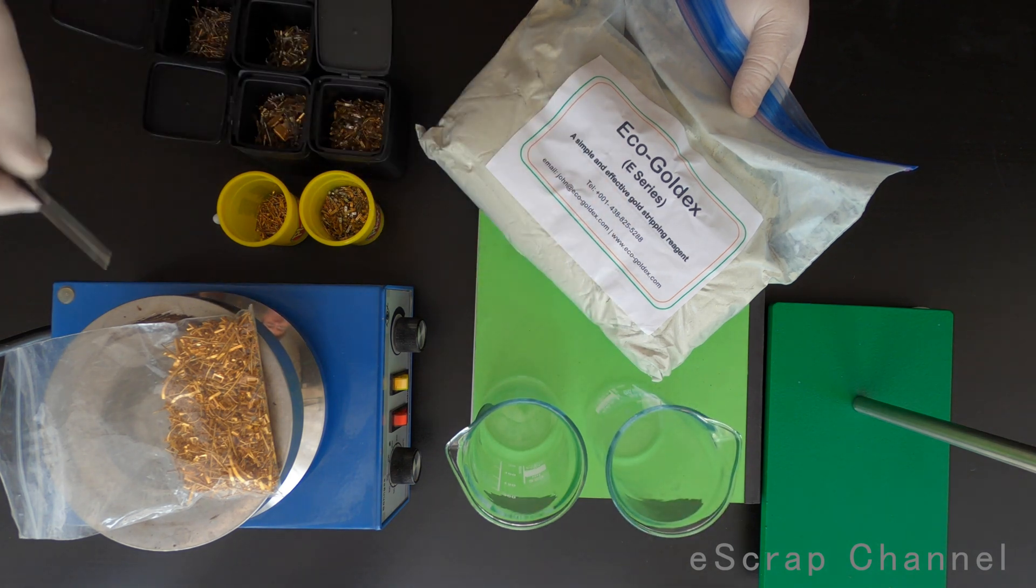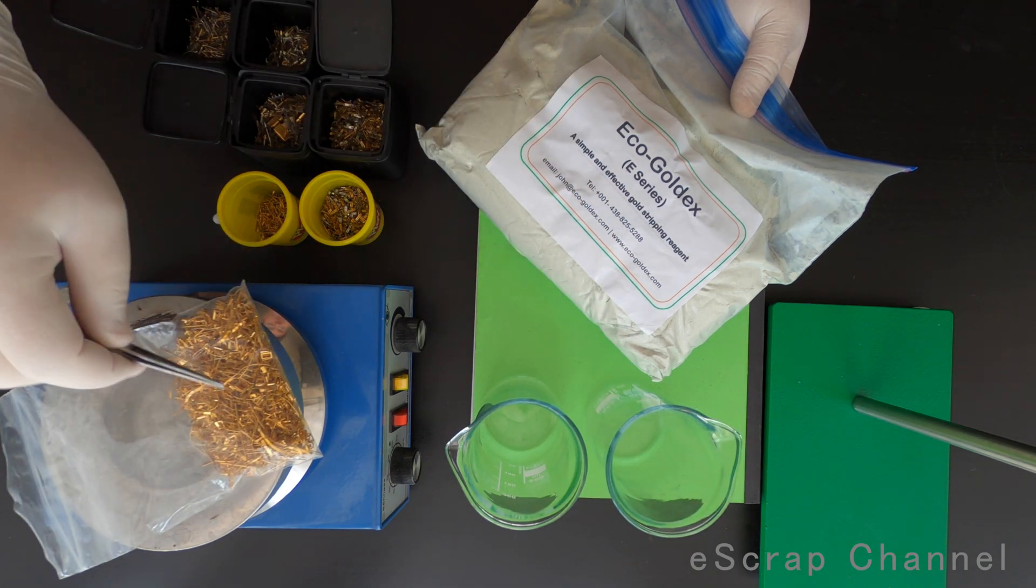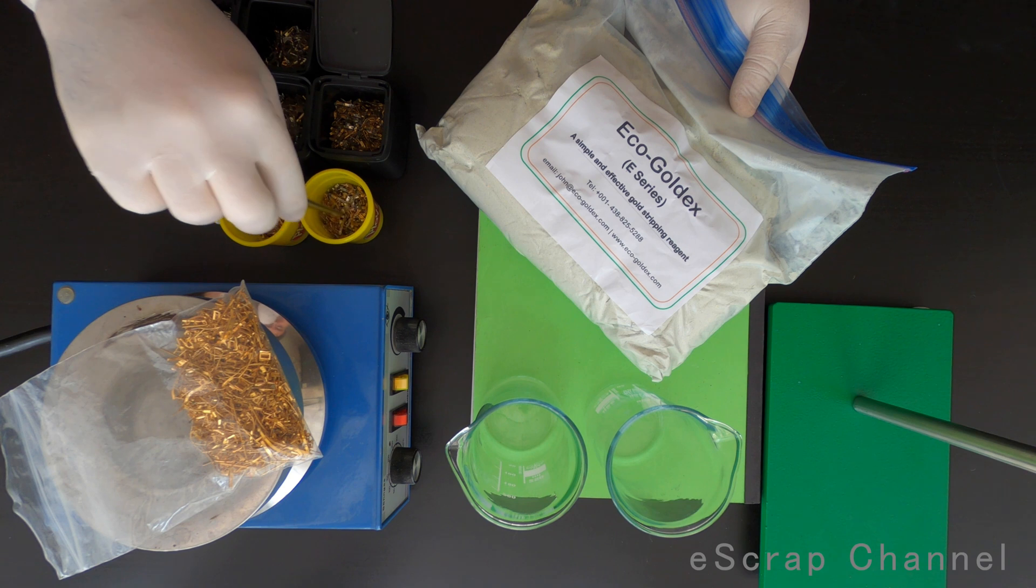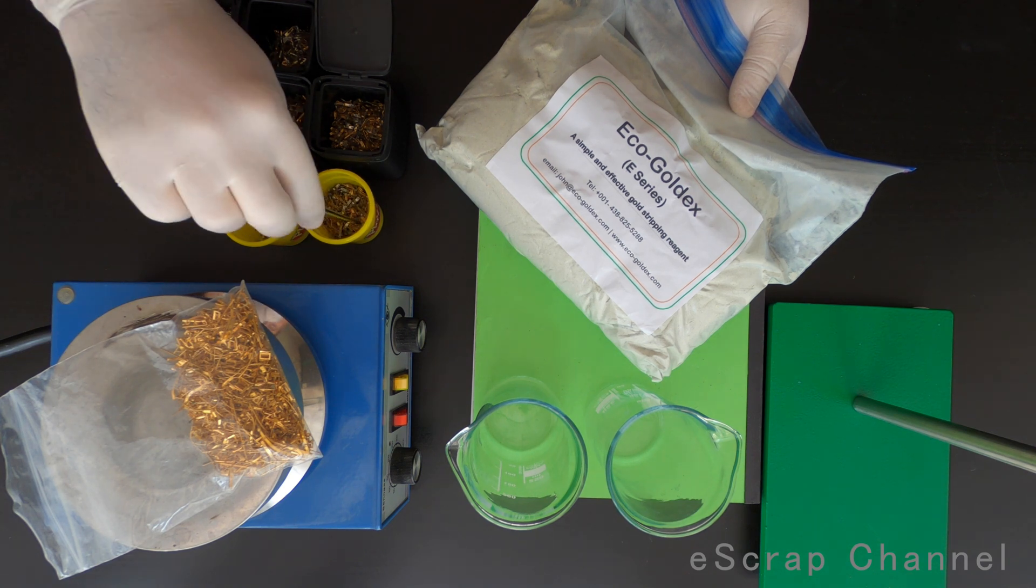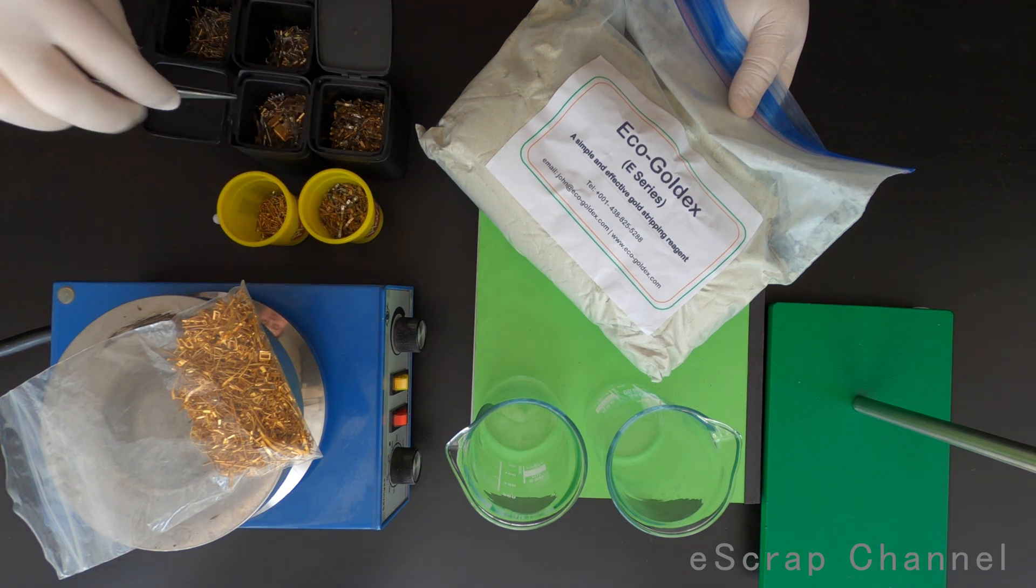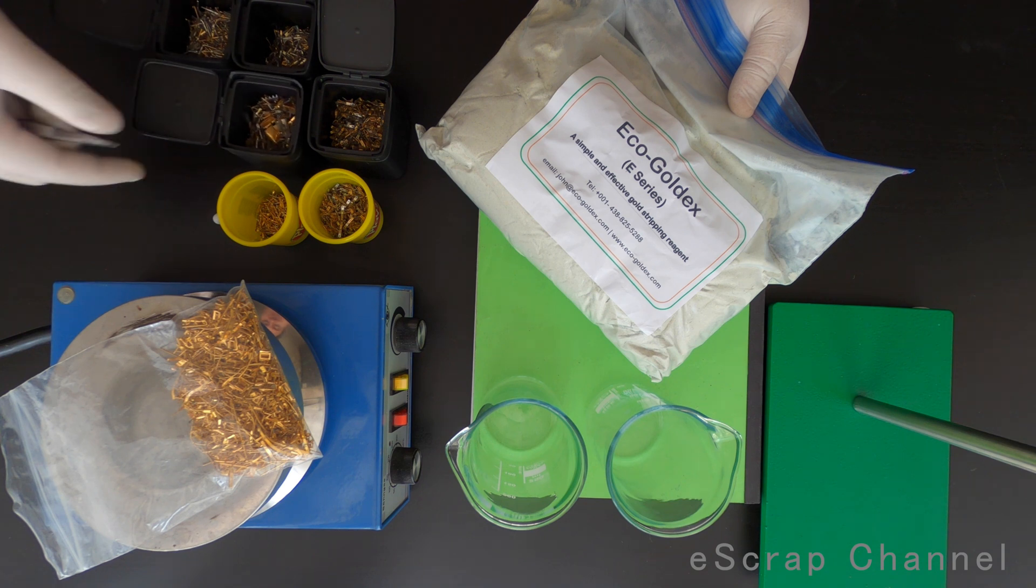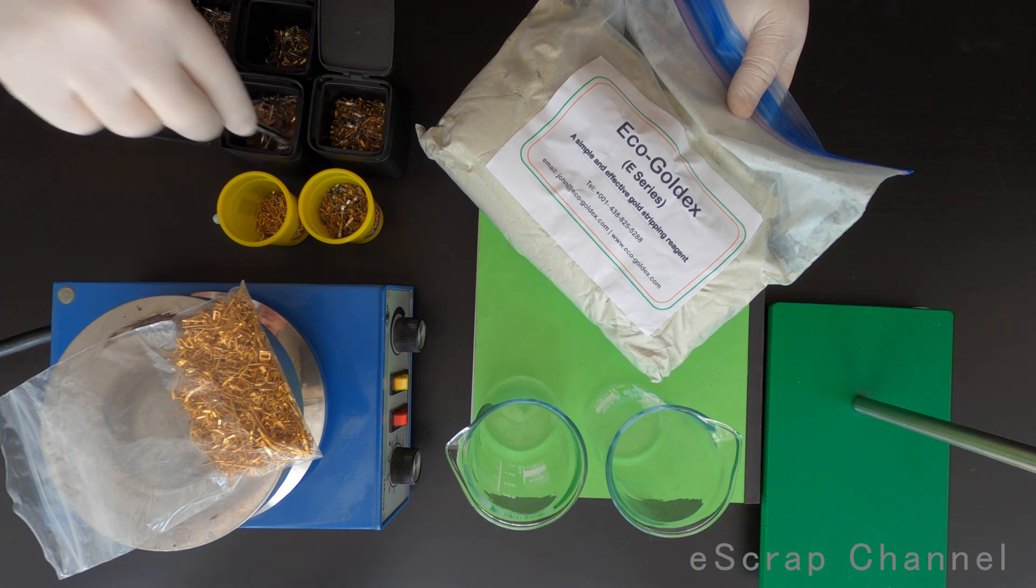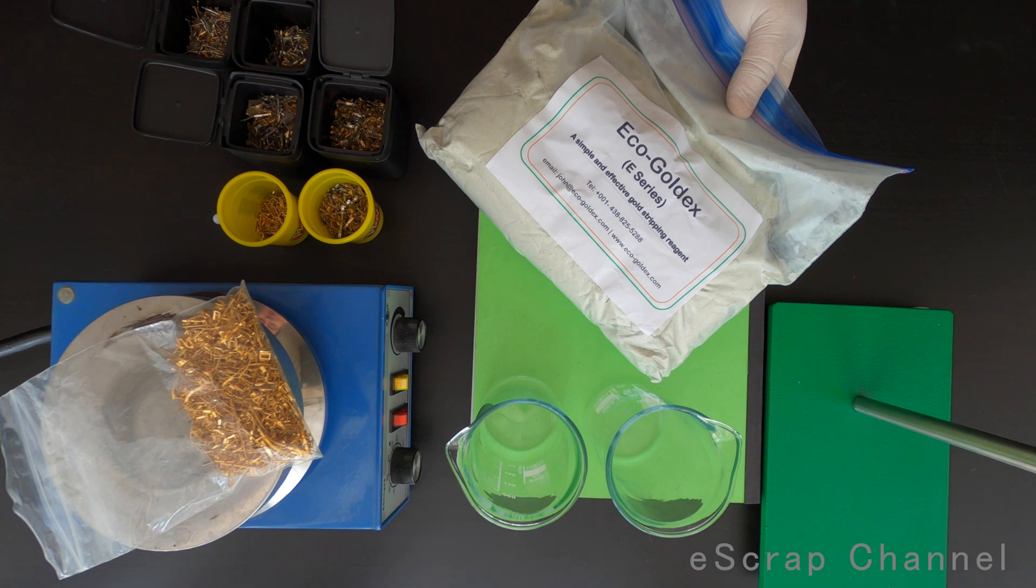I have these two beakers, I have gold pins with different quality: fully gold plated, good quality old ones from 1985, and modern ones with really easy to dissolve gold plating.